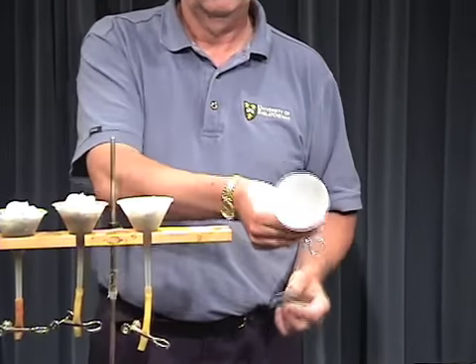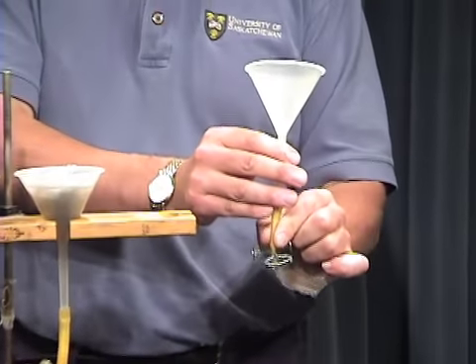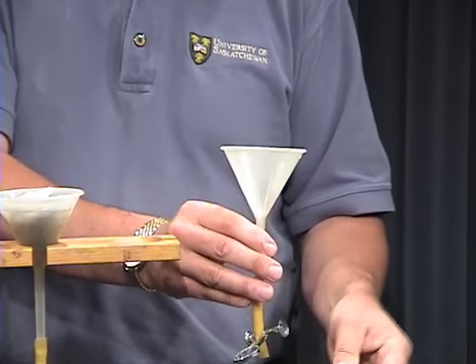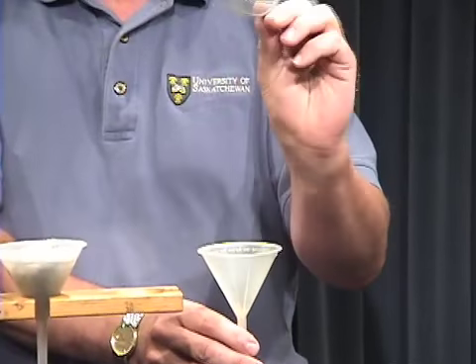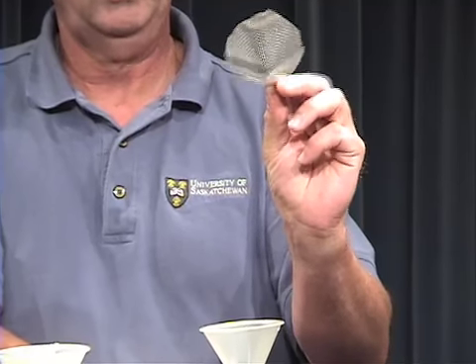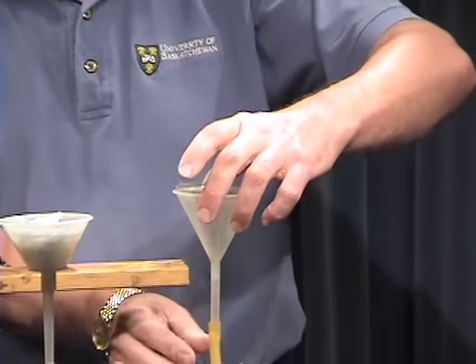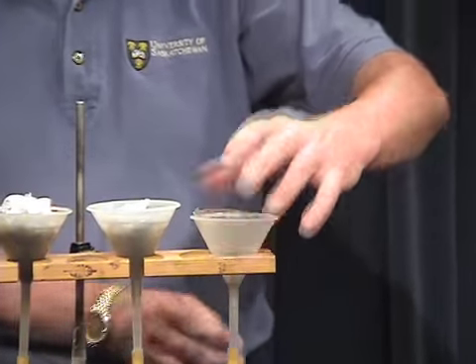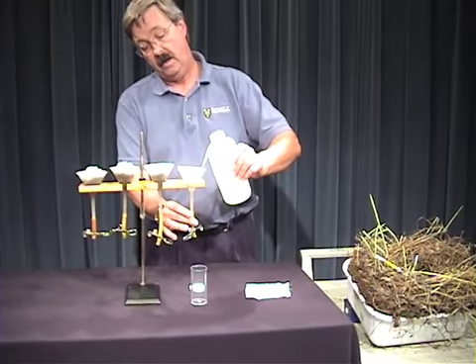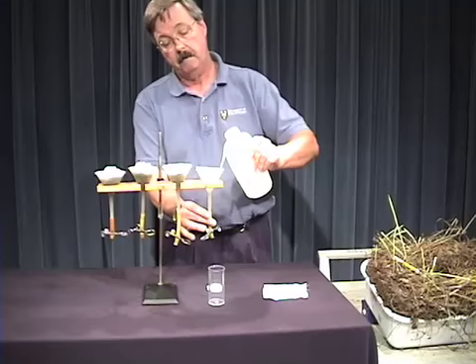Here we have just simply, in this case, a plastic funnel. I have a piece of flexible tubing, Tygon tubing on the bottom, and what I call a pinch clamp. Okay? And I also have a piece of screen, something that you might find in a screen door. Okay, and you see I've molded it so that it'll fit inside the funnel. So I'm going to put the funnel here. I'm going to start off by adding some water to the funnel like that. Bring it up part way, so I'll partially fill this funnel with water.